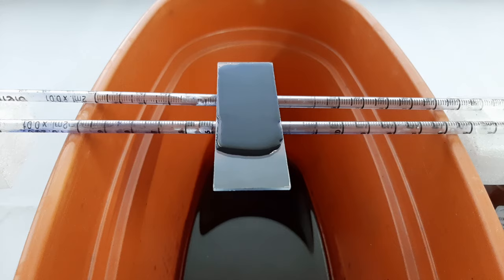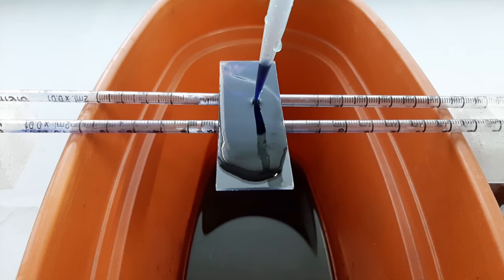After the incubation is complete, directly add approximately 1 ml of Leishman's buffer onto the stain.